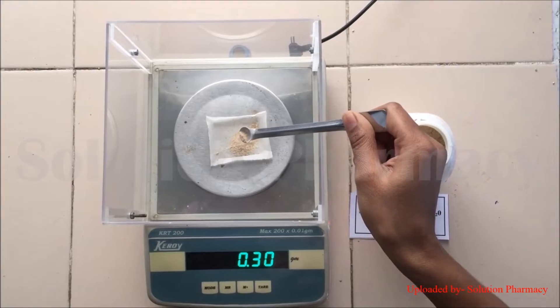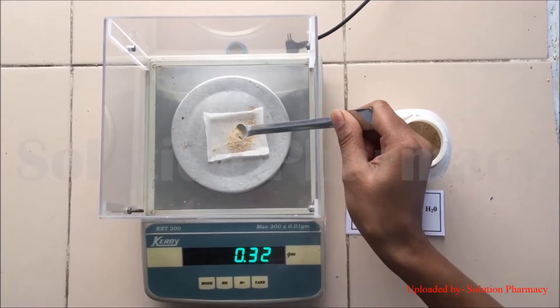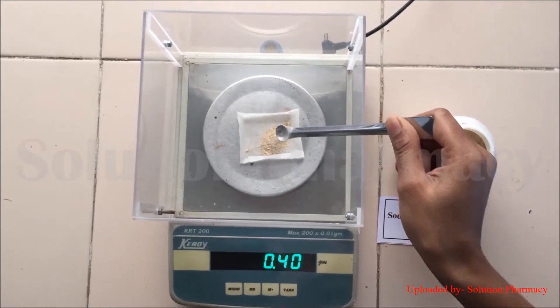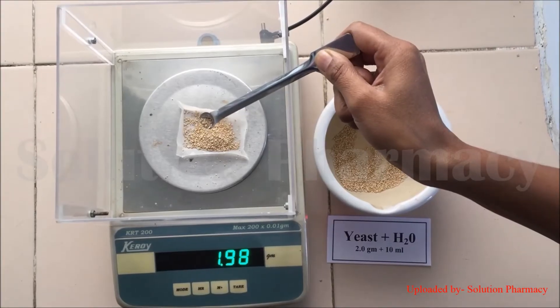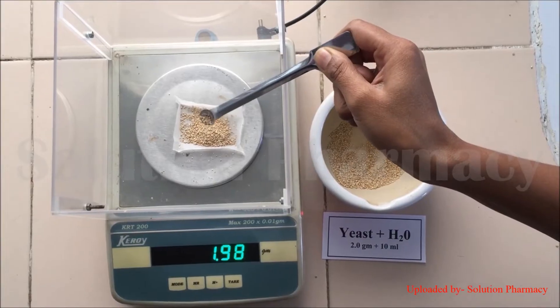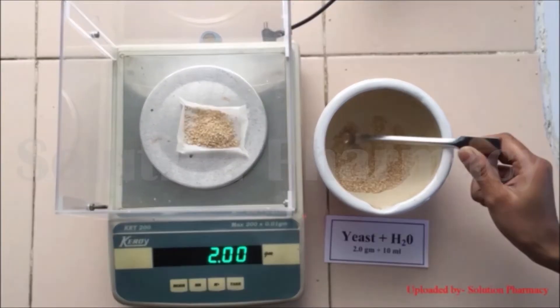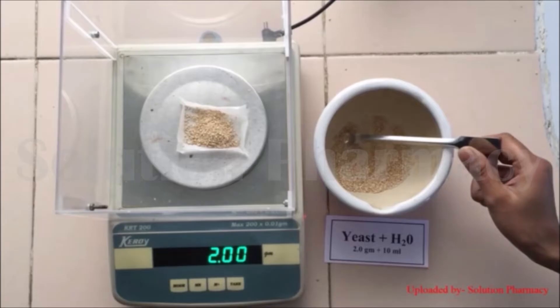First of all, weigh all the ingredients. Our first ingredient is sodium alginate — weigh about 0.4 gram of sodium alginate and keep it aside. Then weigh yeast — weigh about 2 grams of yeast.